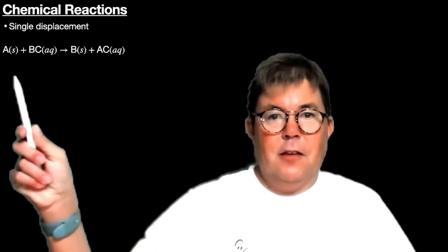In today's video, I'm going to go over the first part of the chemical reactions lab, which deals with single displacement reactions and the reactivity of metals. This experiment deals with chemical reactions, and on the screen I have the general form of a single displacement reaction.